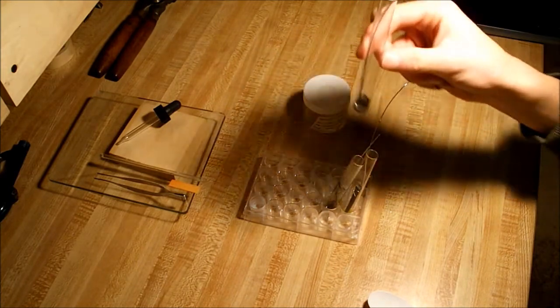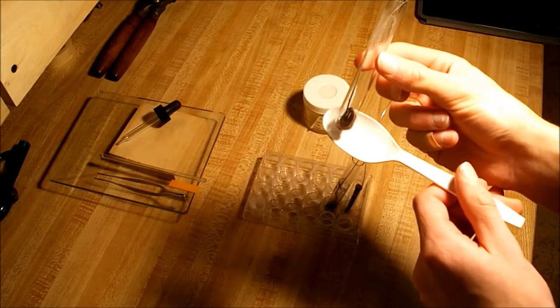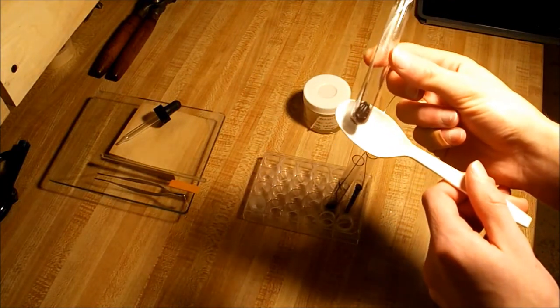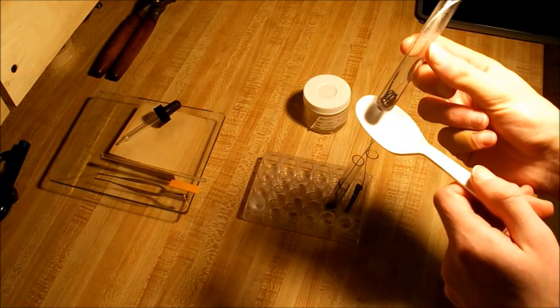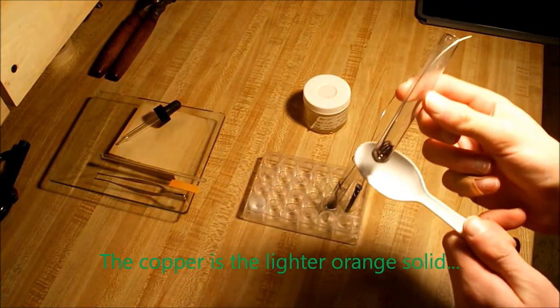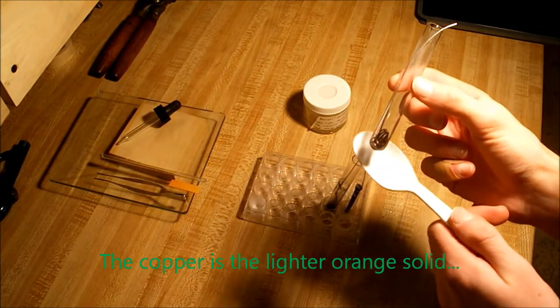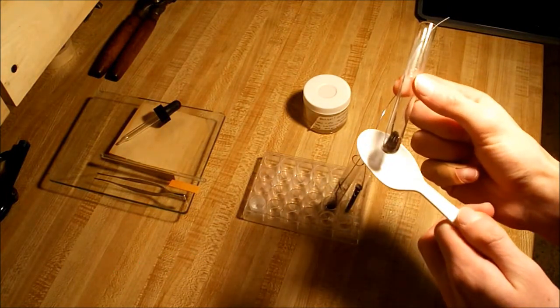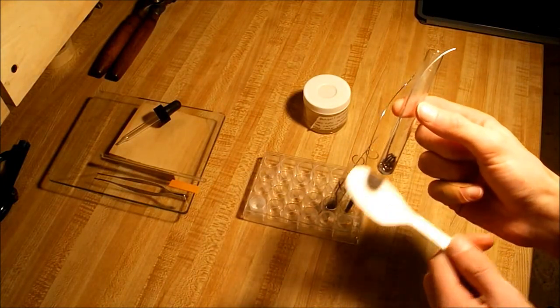Now after we added the aluminum wire, you can see that the aluminum has taken the place of the copper and left the copper metal by itself as its own solid. But when we added the aluminum wire to the copper chloride solution, it became aluminum chloride, which is actually clear, and copper metal. The copper settled out in a single displacement reaction.